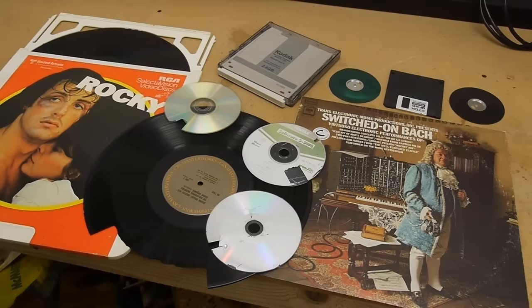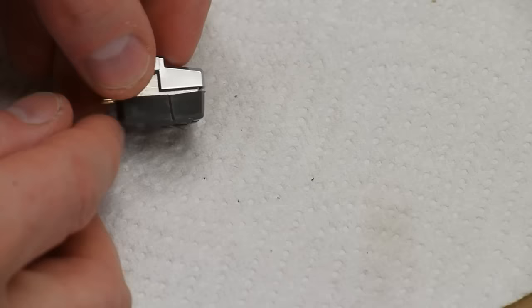Normally this is done with a machine called a sputter coater, but my sputter coater needs some work so I'm using physical vapor deposition. So this is enough to image the record by itself.